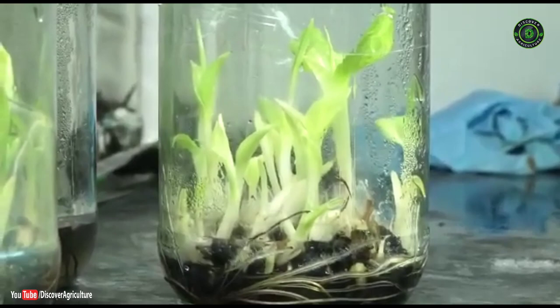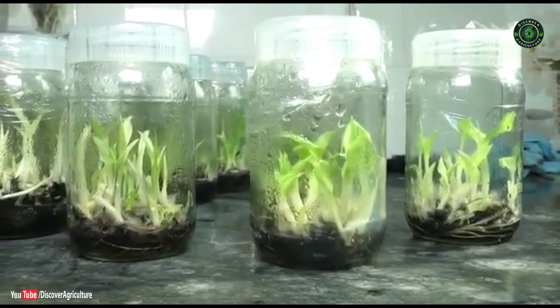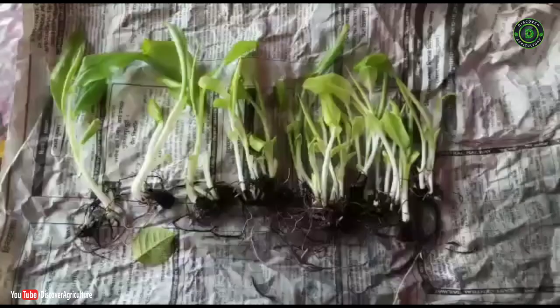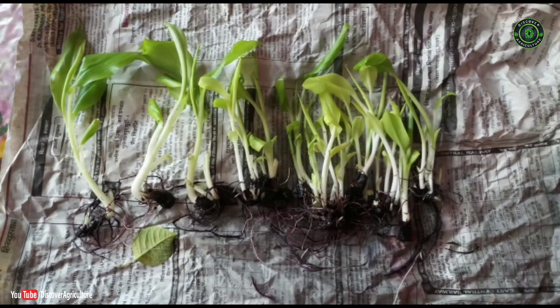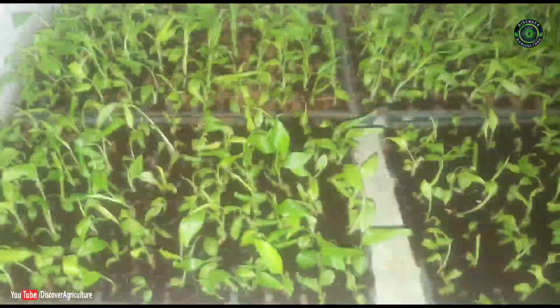Once the plantlets are ready for shifting outside the laboratory, they are carefully acclimatized to adapt to the external environment. The plantlets from culture vessels are moved from the laboratory to a room at ambient temperature and kept open for 4–6 days. Later, they are shifted to a greenhouse for primary hardening where they are first gently washed free of agar medium, as sucrose in agar encourages microorganism growth.